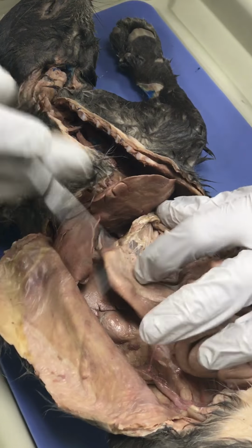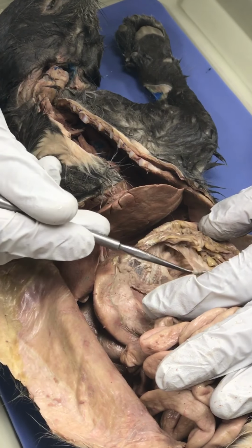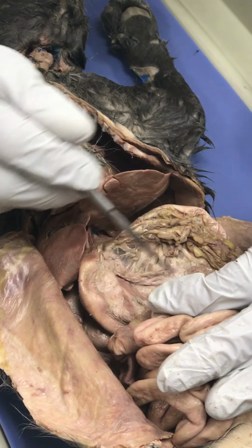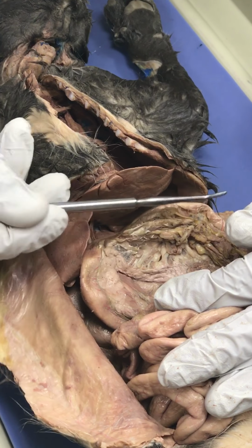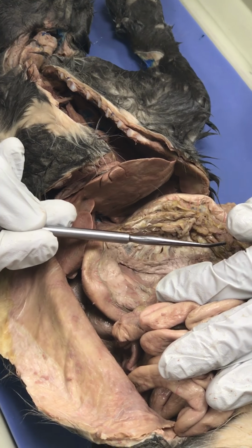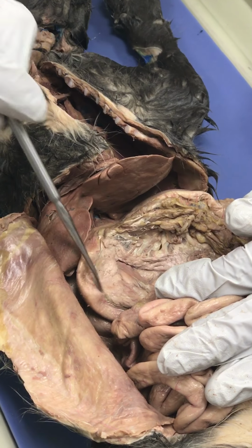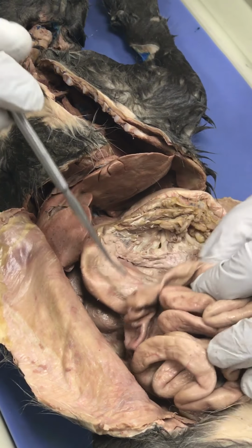This is pancreas here, and this is pancreas here. And here it is supported by a part of the greater omentum also. So the pancreas in the human pretty much just goes transverse underneath the stomach, but in the cat, it goes up transversely, and it also has a descending portion to it that's connected to the duodenum. All right? Interesting.